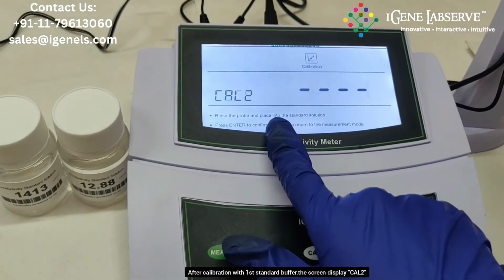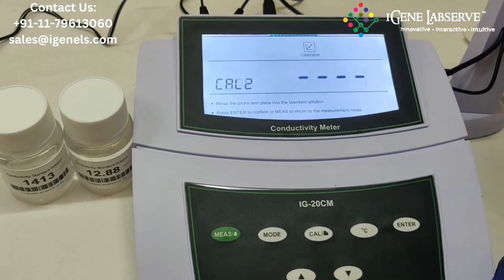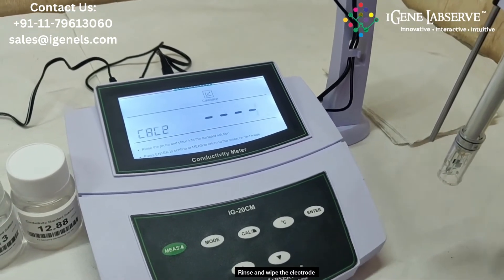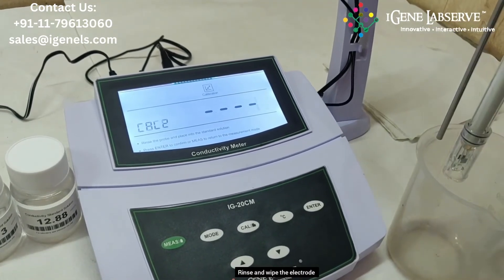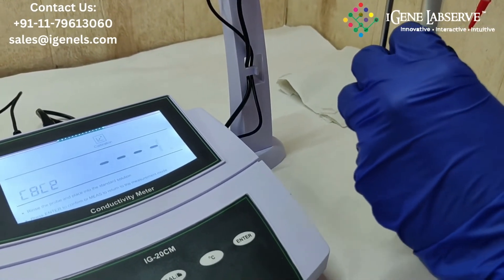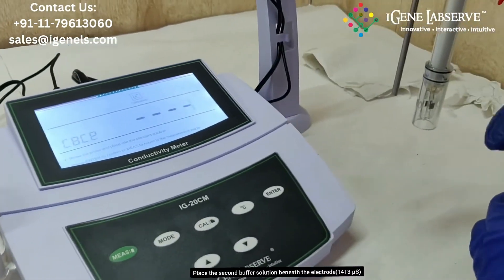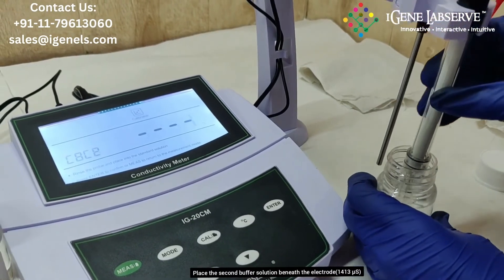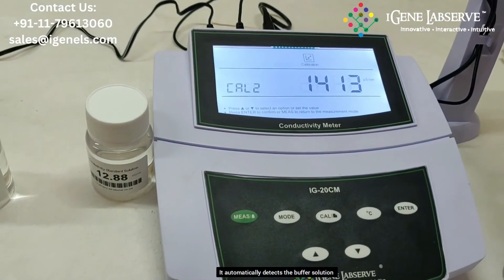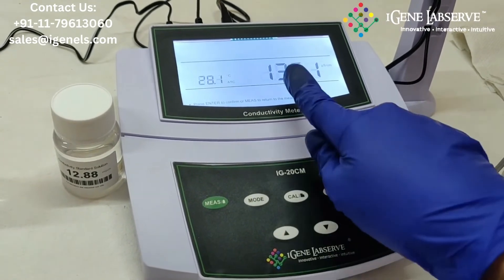After calibration one is completed, it automatically goes to calibration two. Remove the electrode from the solution and wash it using distilled water, then wipe it with a tissue. Take the second standard solution, place the electrode in it, and once it automatically detects the standard buffer solution, press enter and it begins to calibrate.